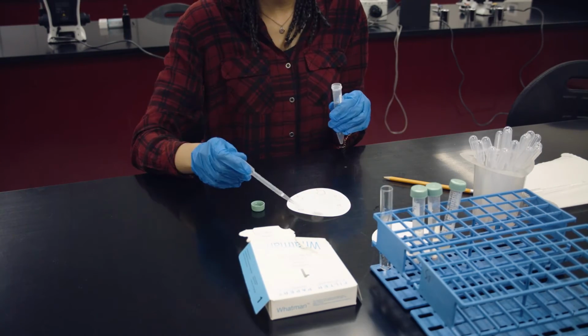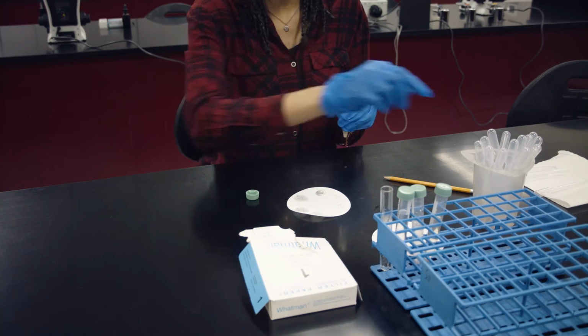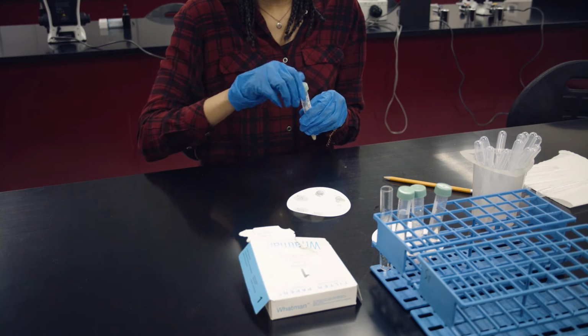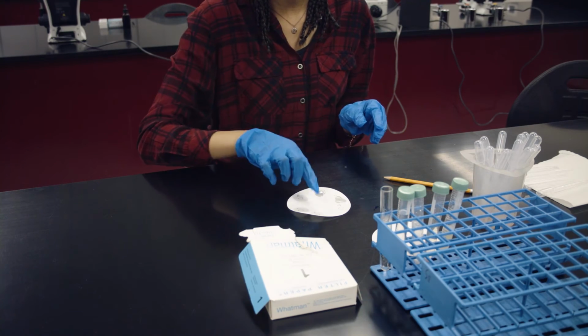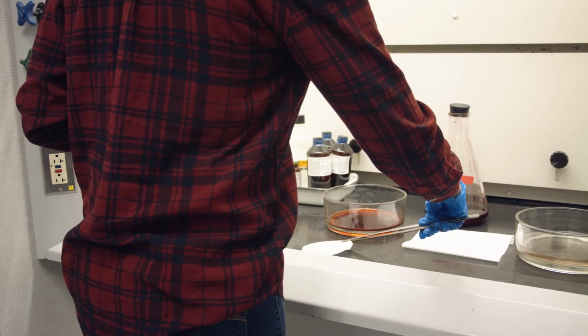Obtain 6 solutions. Using a different plastic pipette for each sample solution, place 2 drops of the designated sample onto the appropriate circle. Once completed, allow your filter paper circle to air dry. Once the filter paper circle is air dried, bring your filter paper circle to the chemical hood in the lab.